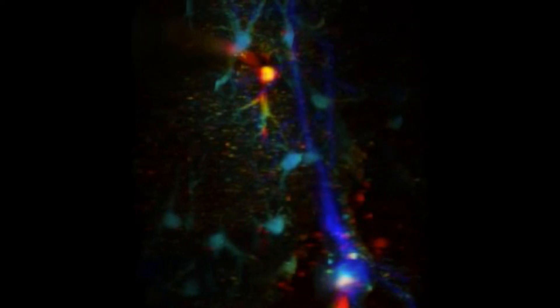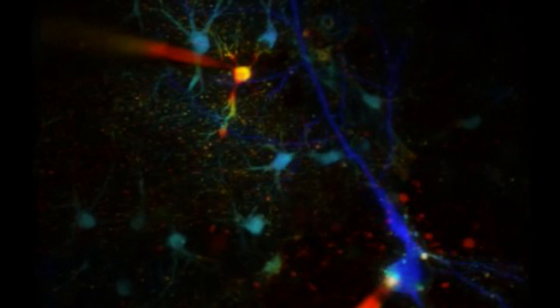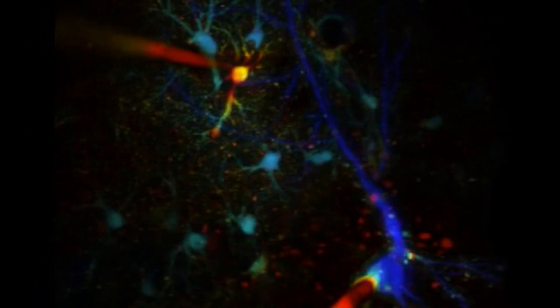The FLIM-based technique that we have adapted has unveiled an unexpectedly rich content of calcium landscapes in neurons and astrocytes. Whether such landscapes contain information about the past activity of local networks, and whether they set some functional modalities to various cells and their microscopic compartments, remains an important and intriguing question.